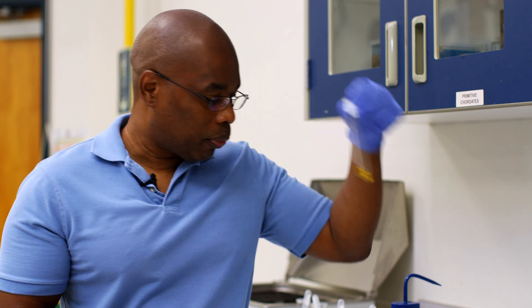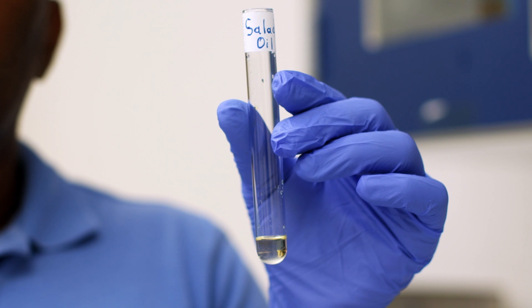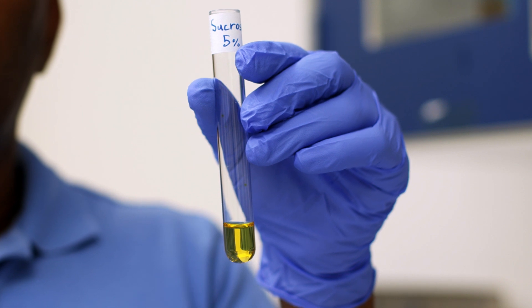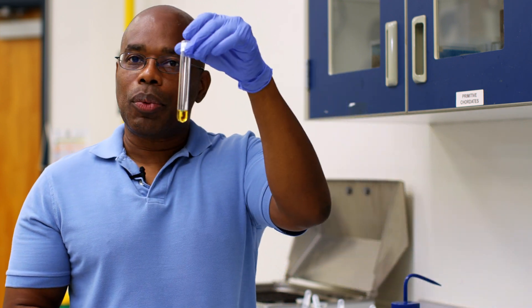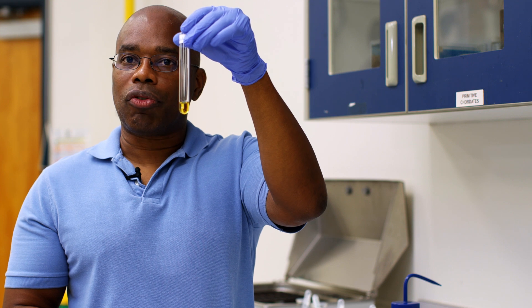This is a negative control. Our next solution is salad oil — as the name implies, we should not expect to see a reaction with salad oil; it is not a starch. We have sucrose, and again, as we previously saw in the Benedict's test, sucrose is a sugar, so this is also a negative control. And then lastly, we have water. Pure water should have no organic molecules in it, so again, this is a negative result — it is a negative control.